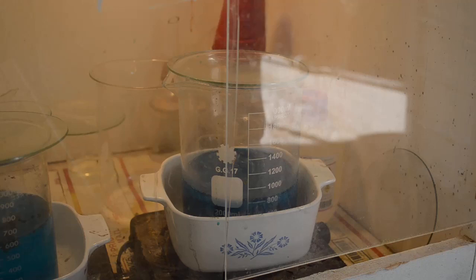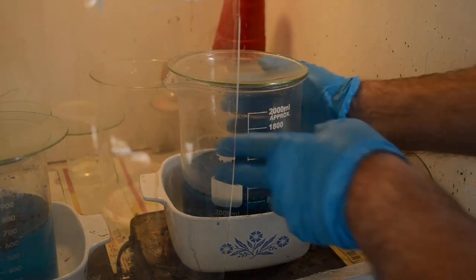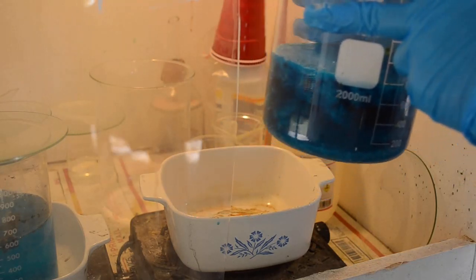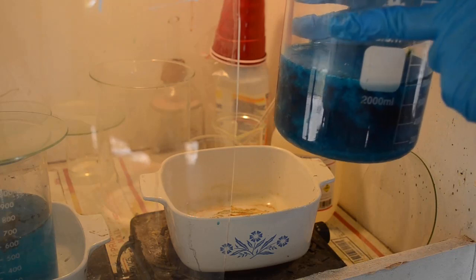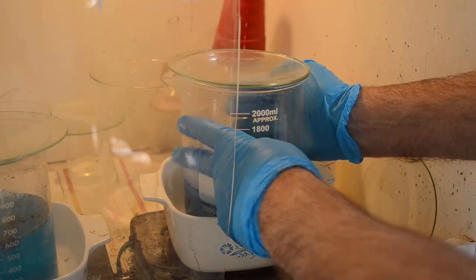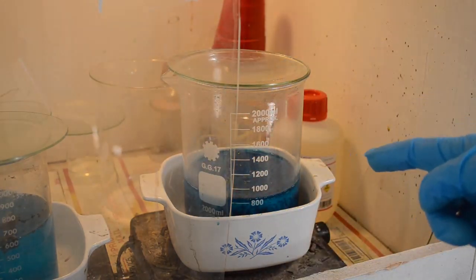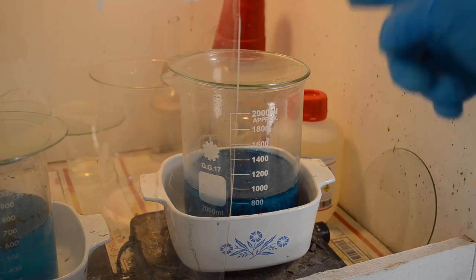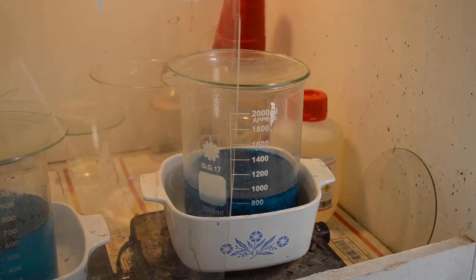Okay, it's the next day. In fact, it's mid-afternoon the next day. It got very cold last night, and just as I thought might happen, look at that. Not only did we get some crystals formed, this thing's almost crystals all the way through. There's still some liquid in there. So, I'm going to pour off that liquid into a smaller beaker and evaporate that and see if we can get more crystals out of it.